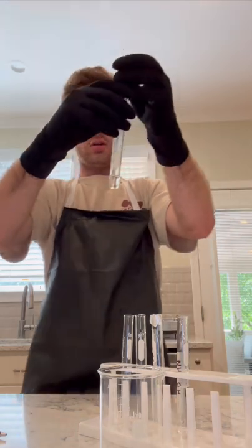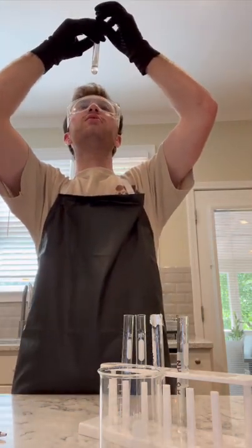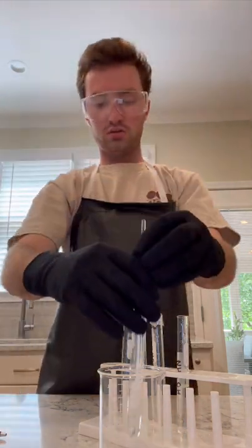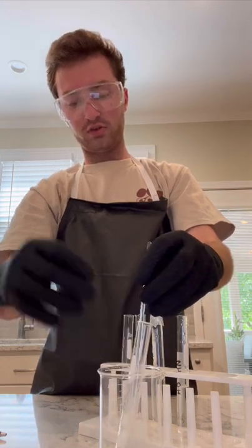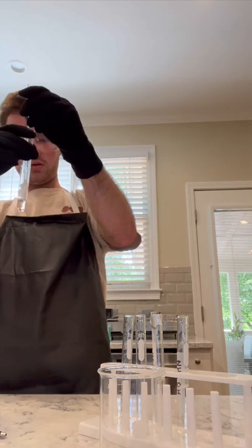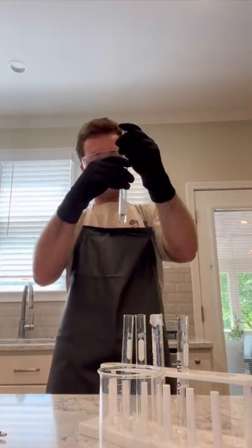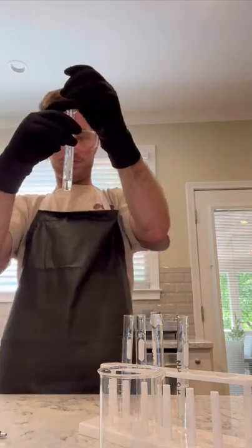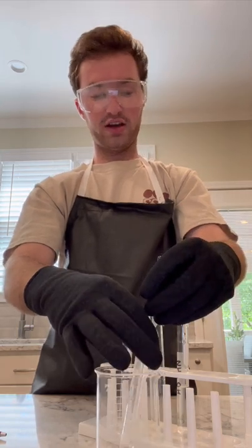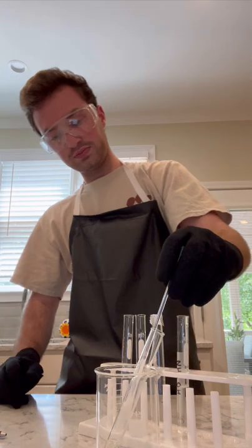I can't tell from the video, but it appears that a little bit of solid is starting to form at the bottom of the HCl. I'm not sure if that's what's supposed to happen, but it appears something's starting to react down there. Not a lot physically is changing besides that, but since that's forming, it appears it's going to be an exothermic reaction type. Energy is being released, it looks like.